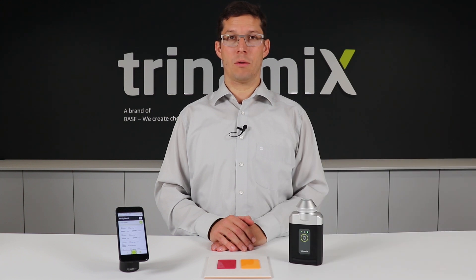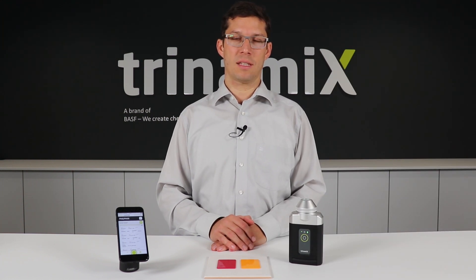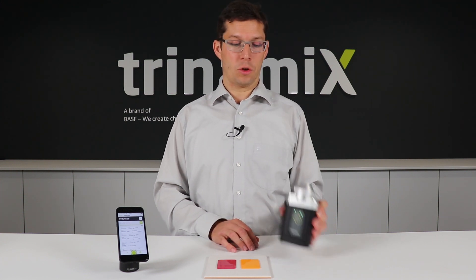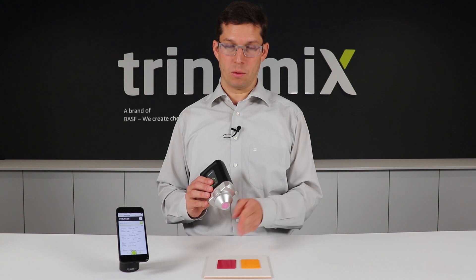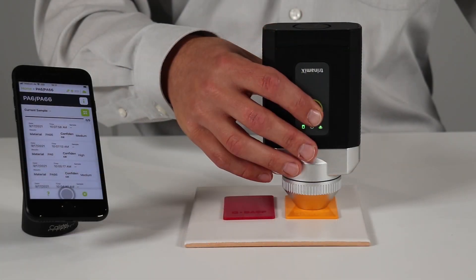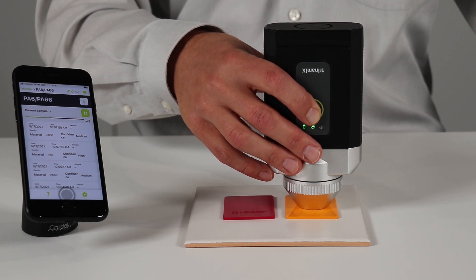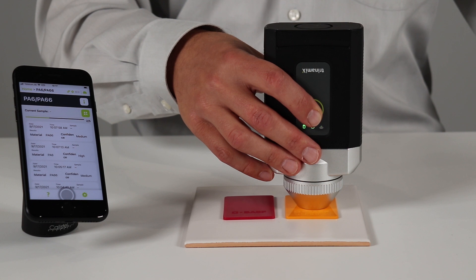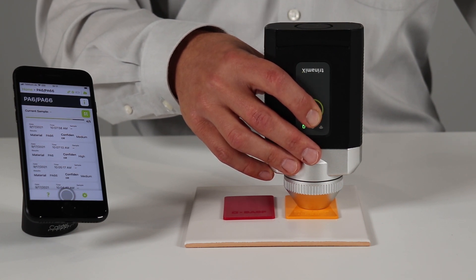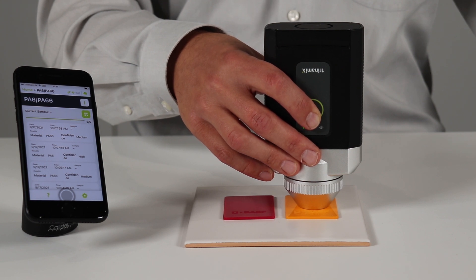Also in our portfolio is the distinguishing of PA6 and PA66. We have two samples here. Put the spectrometer on the sample and start the measuring. You have to take five samples, and as usual, the result is being displayed in the app.